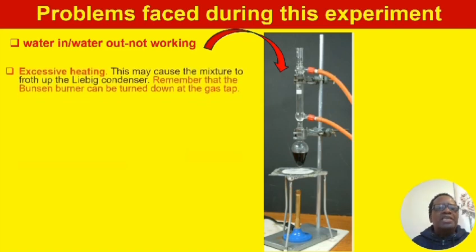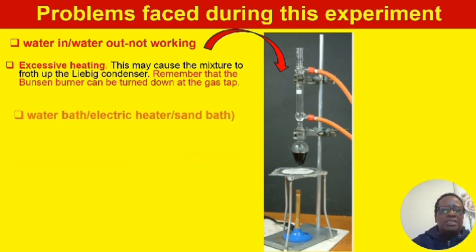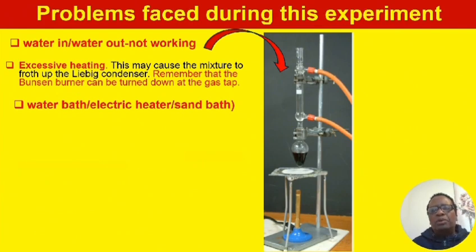But I could say the major problem was excessive heating. We controlled heating by turning down the gas tap, controlling the flow of gas to reduce the heating. What we could have done was probably use a wire gauze, as shown in this experiment. The wire gauze spreads the heating, or alternatively hold the bunsen in your hands and move it across the pear-shaped flask. If we had done that, we could have succeeded.